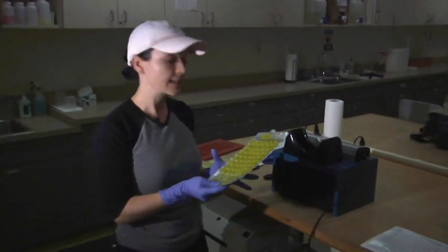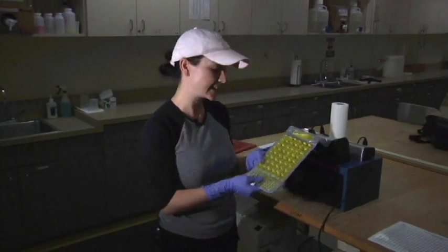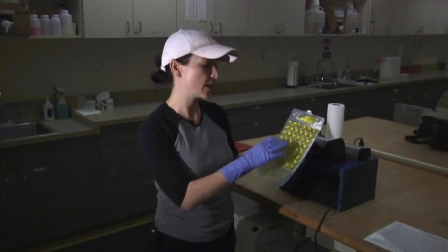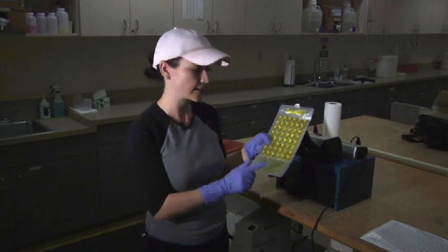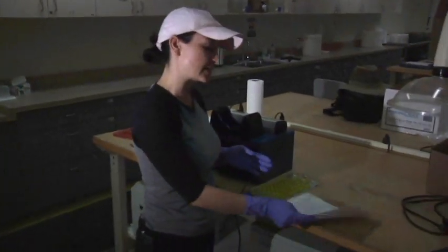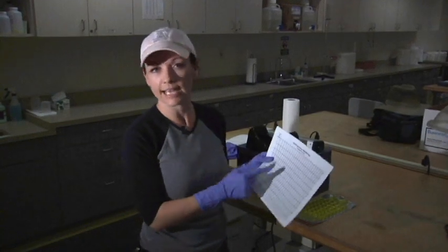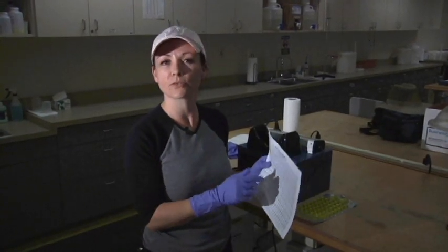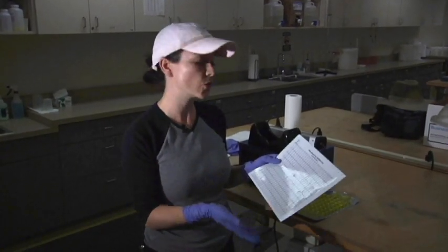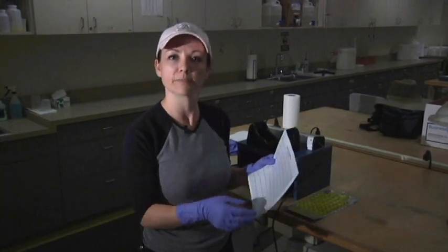I finished marking the cells that were fluorescing under the UV light and I can take it out now. I'll count the number of large cells and small cells, and then I'll use this table to get a number that we'll put in the database — that number will be used for assessment. That lets us know how much E. coli was in the stream at that point in time and day of sampling.